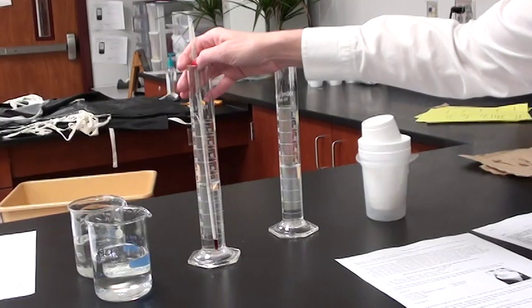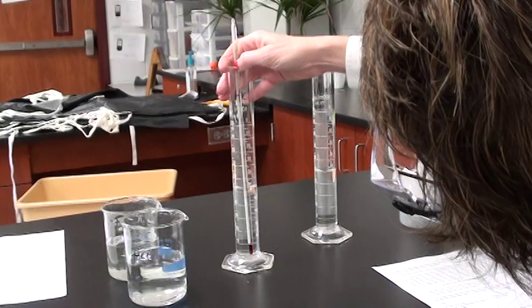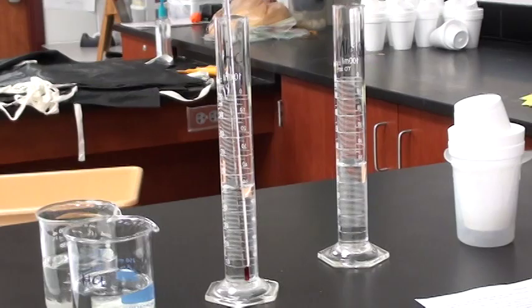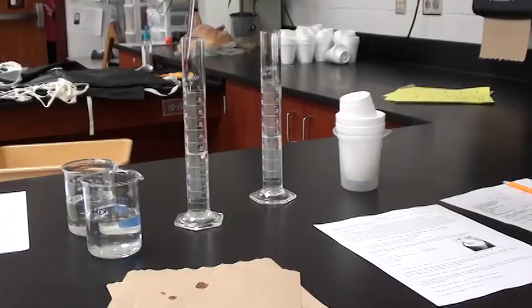The HCl has a temperature of 21.1 degrees. I'm going to take this out and rinse it off with water.